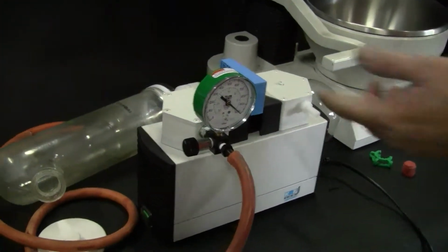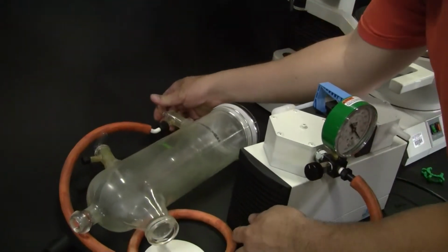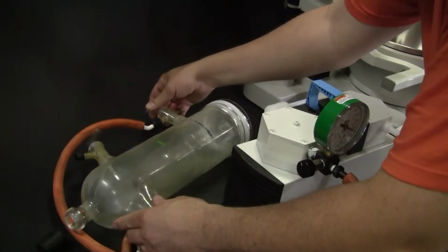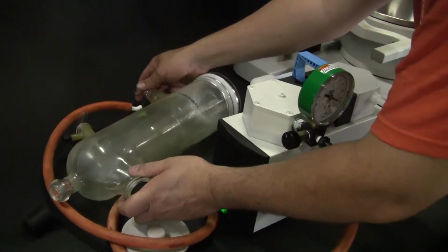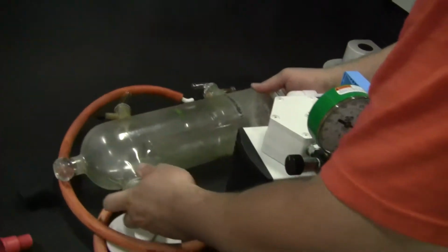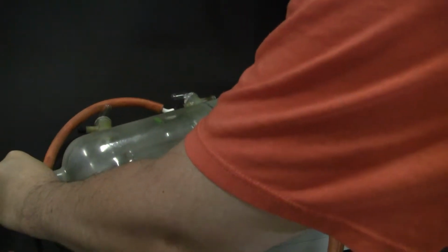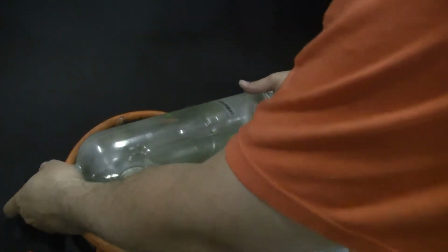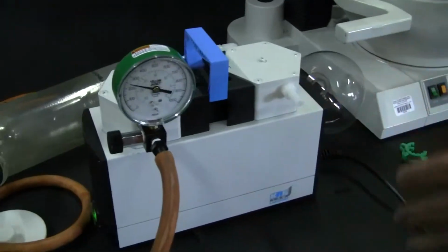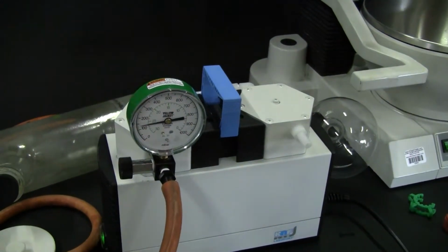So I've hooked up the vacuum. I'm going to turn the pump on. Take some rubber stoppers. Now I can hear the pump working, I can feel it. Now what the gauge allows me to do is actually see, hey, that's good, it's holding.